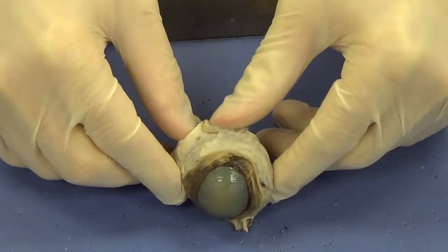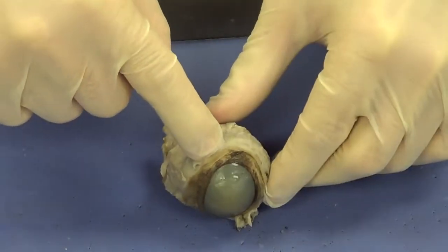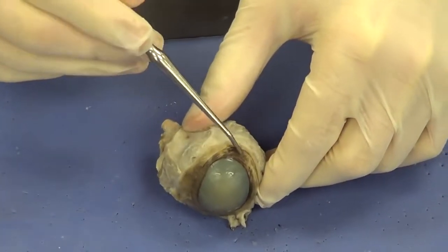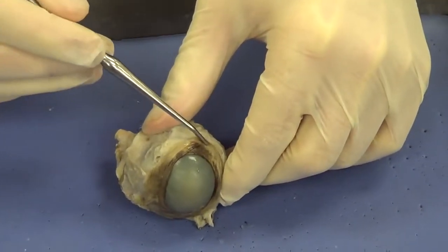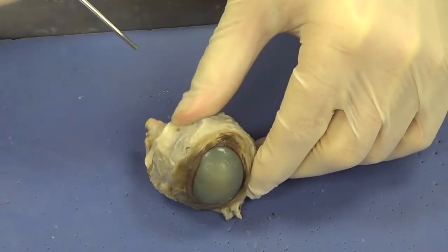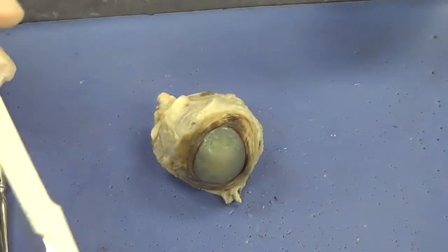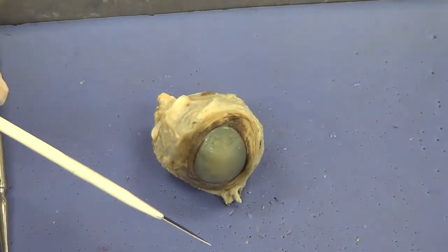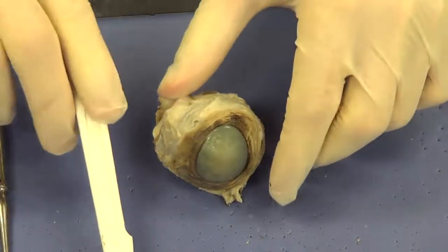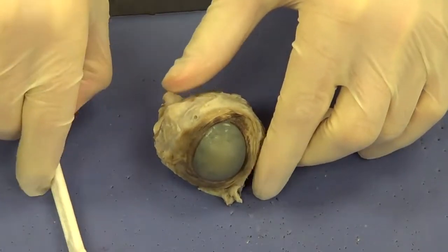We want to start the internal dissection by cutting the eye just posterior to the cornea. Now, under some of this connective tissue is going to be another layer called the sclera. And we'll see that a little bit more clearly after we cut into the eye. So what I'm going to do here is take a scalpel and hold it a certain way because I don't want the scalpel to slip. And this sclera that I was talking about is very tough to cut through.